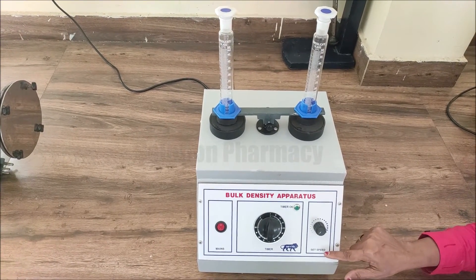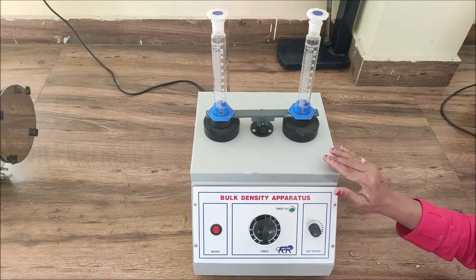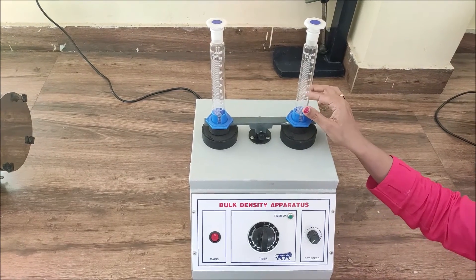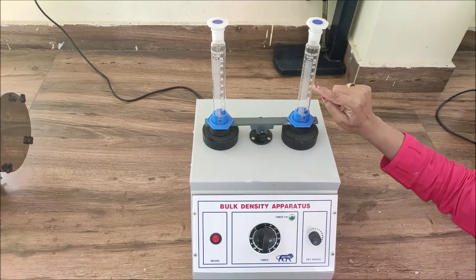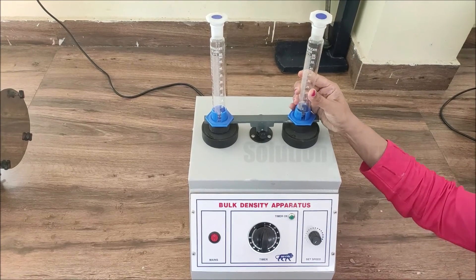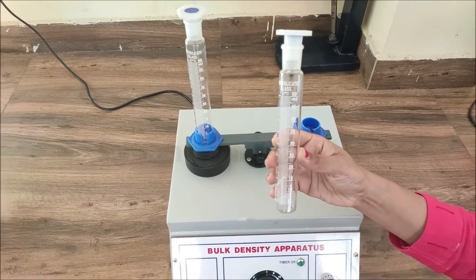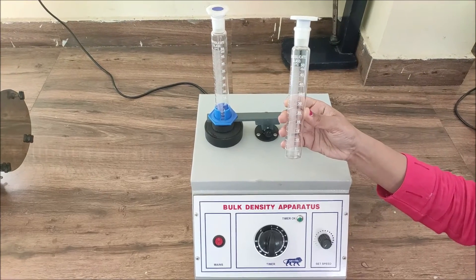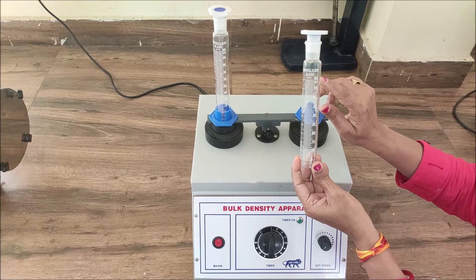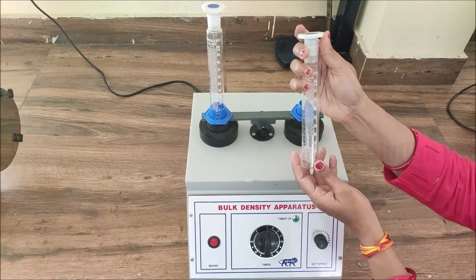Next, this knob is the speed setting knob to set the speed of tapping — we can increase or decrease the tapping speed with this knob. At the top of the bulk density apparatus you can see there are two measuring cylinders, or graduated cylinders, with markings to measure volume. This cylinder has a total capacity of 50 ml, with markings starting at 5 and increasing in steps of 5 — so 10, 15, 20, 25, 30, up to 50 ml. Each part is divided into 10 divisions, so the value of each division is 0.5 ml, and we measure the volume of powder accordingly.